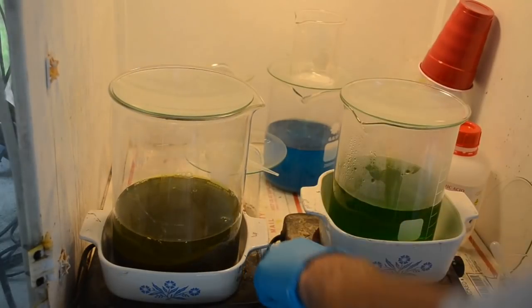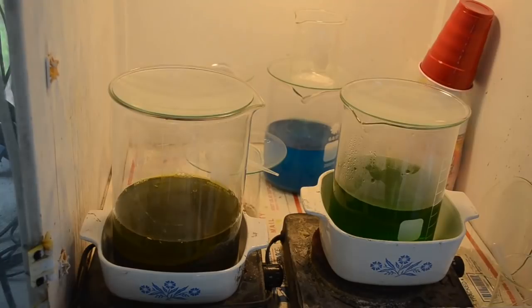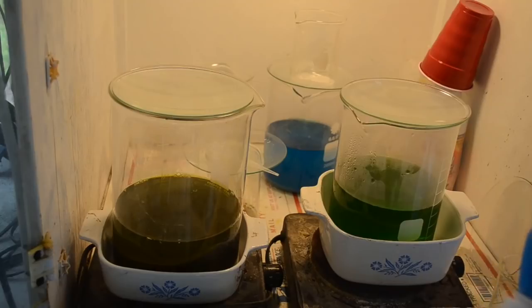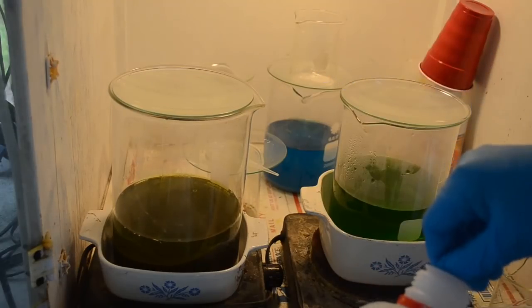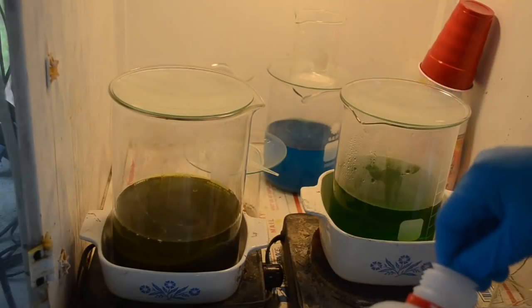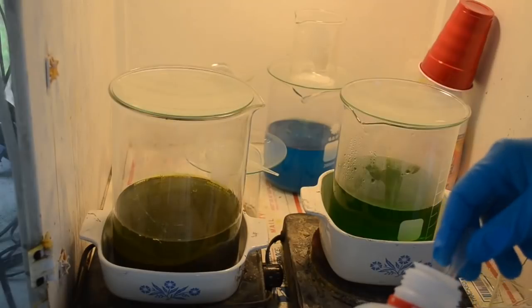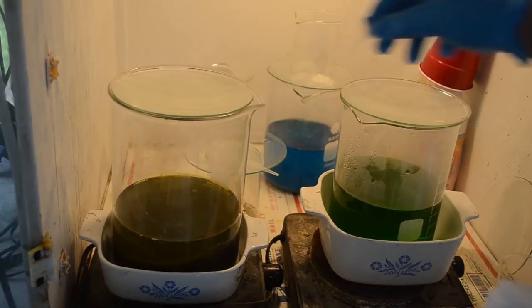Get the heat on it, and we'll add some nitric acid to it. About 2 milliliters, 4, 6. It shouldn't take as much this time. I mean, I put a lot in before and it all disappeared.